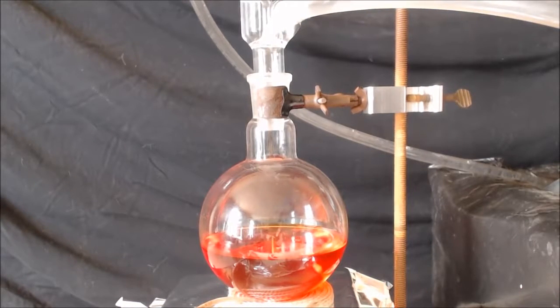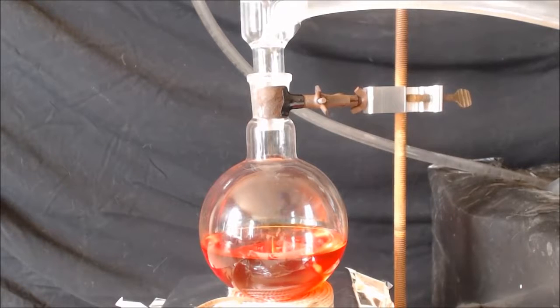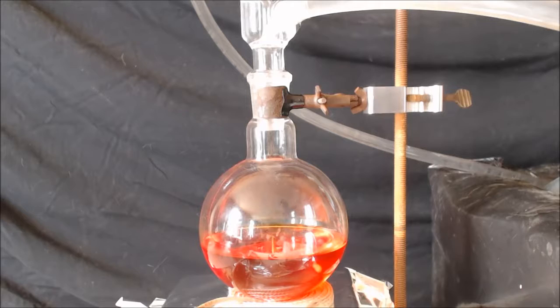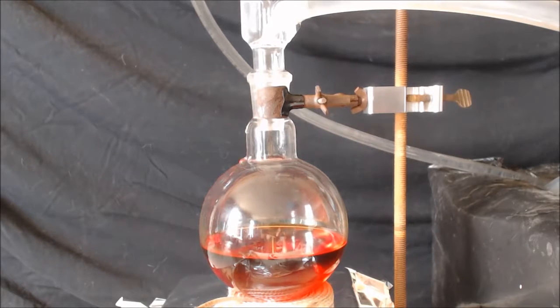Let me turn my pump on. This will produce formaldehyde and I don't want it escaping. You notice last time I put the chromic acid into the stuff I was oxidizing.